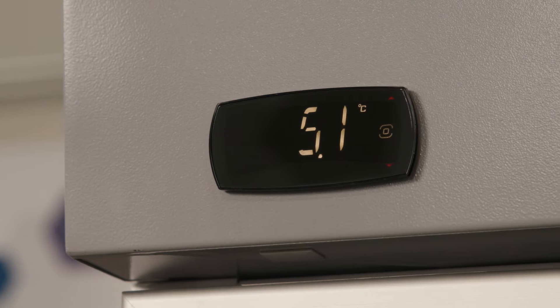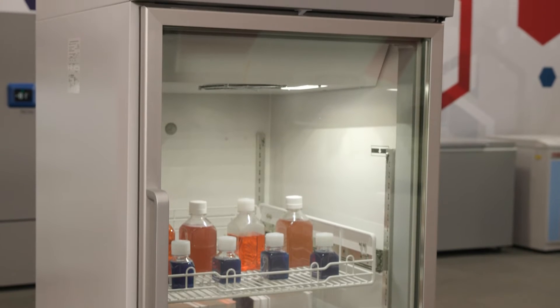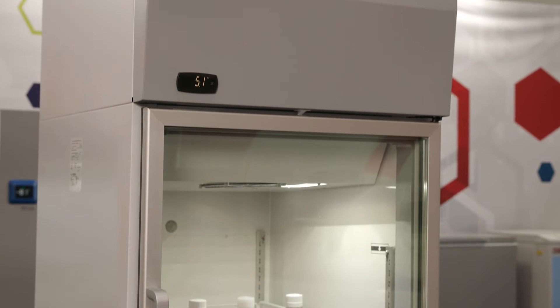Changes to the setpoint of NSF-456 vaccine refrigerators may affect whether the refrigerator still meets the NSF-456 standard.